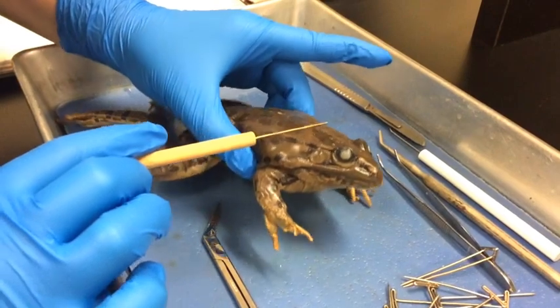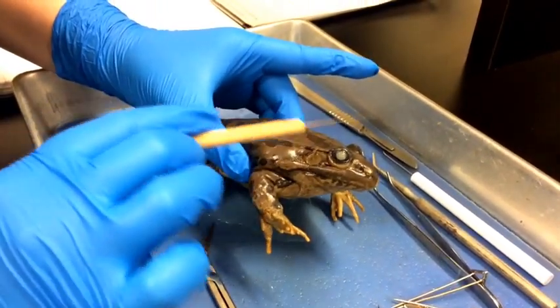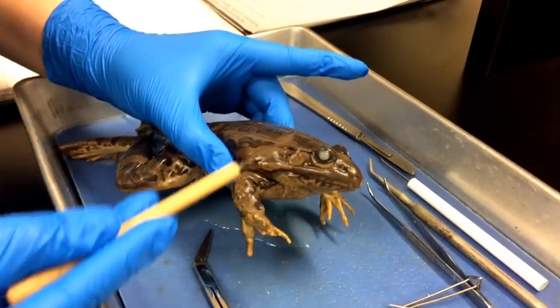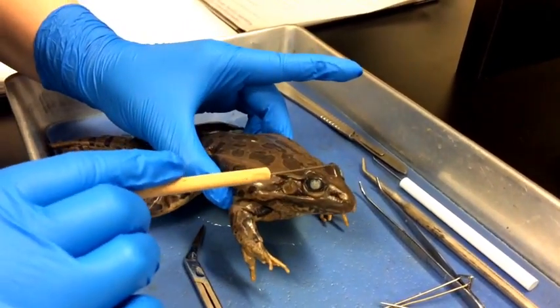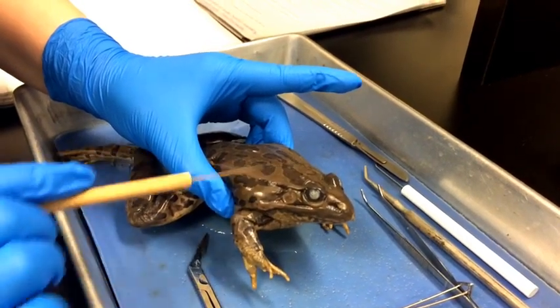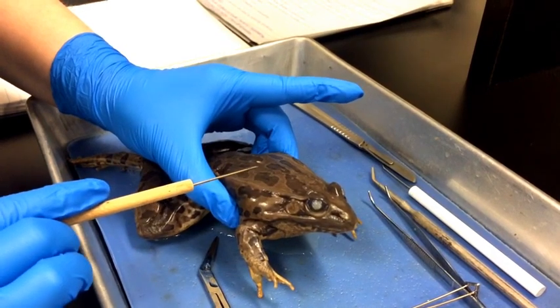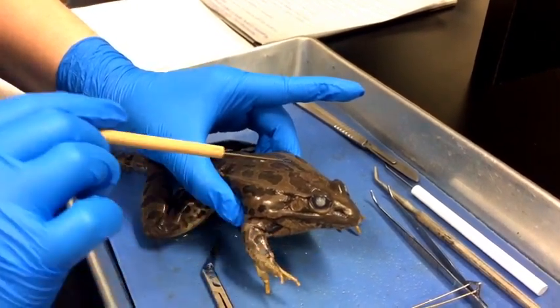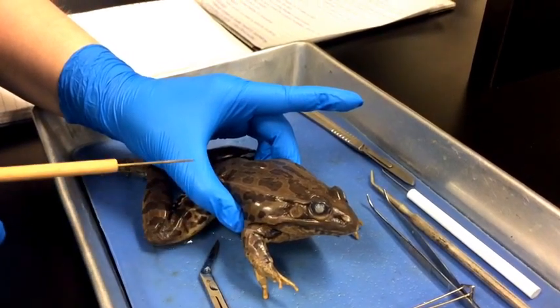As you can see, the frog's eyes sit on top of the head in a bulging way. This allows the frog to see in a 180-degree radius — front, side, and partially to the back — to help it avoid predators and be sensitive to signs of movement.